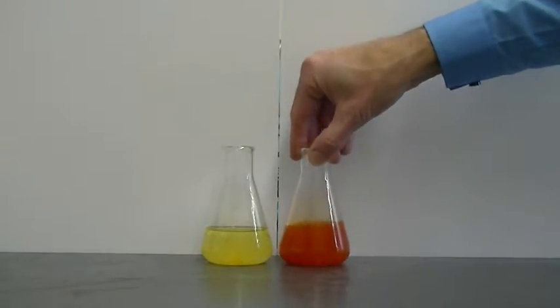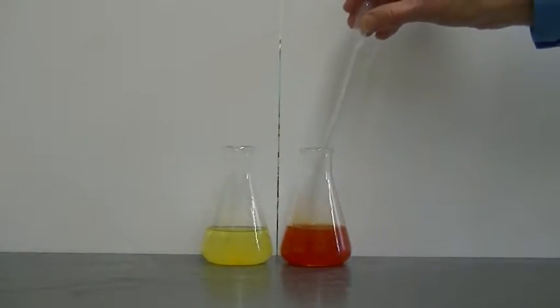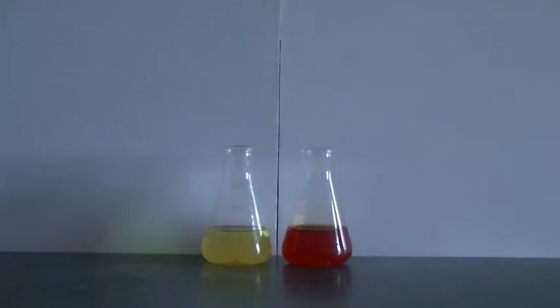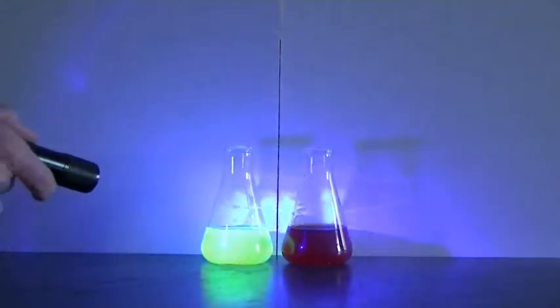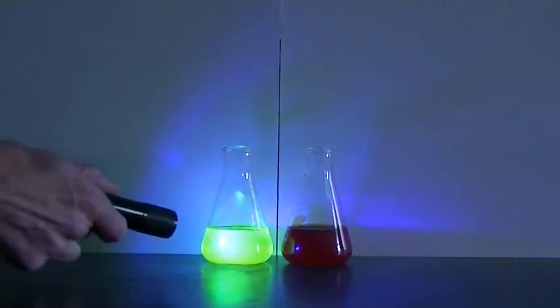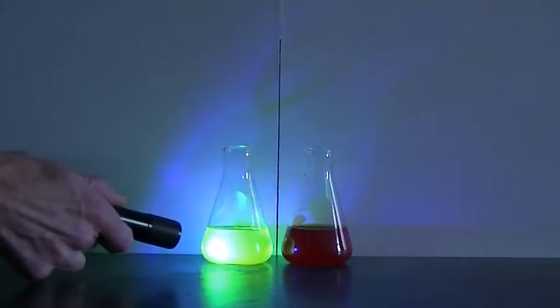And that also shows that the curcumin dissolves into the water. It's interesting to note that curcumin also fluoresces under ultraviolet light. We can see that fairly well by taking a UV light and shining it onto the acetone solution. It gives off a nice bright yellow-green glow.